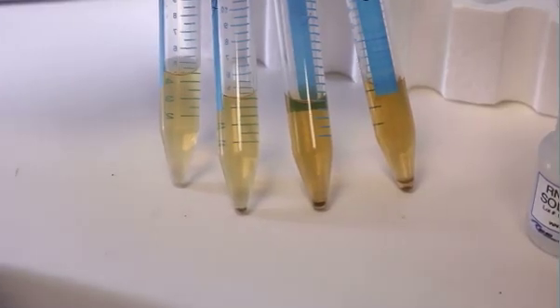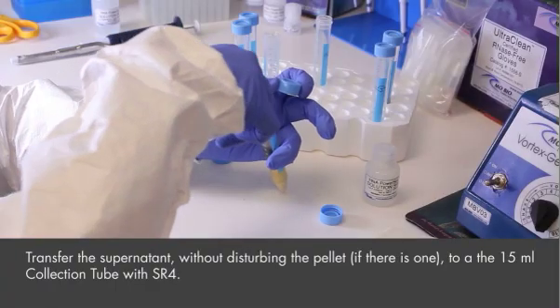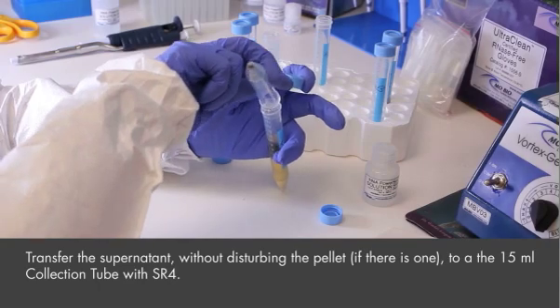Depending on your sample, you may or may not have a visible pellet. Transfer the supernatant without disturbing the pellet, if any. Invert or vortex to mix.